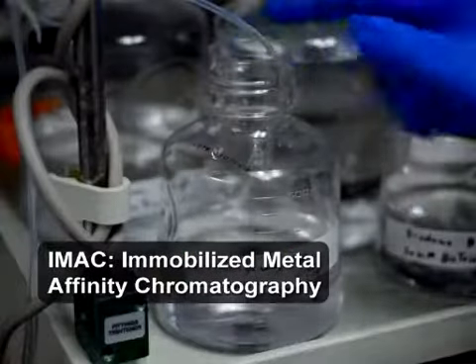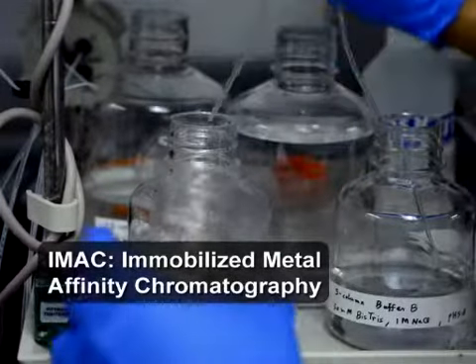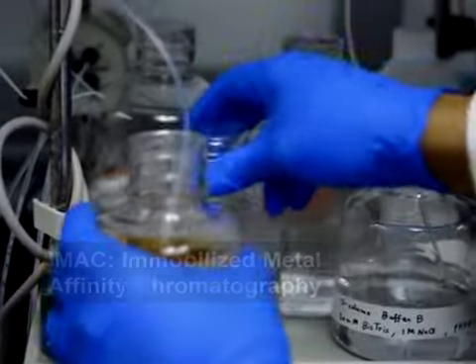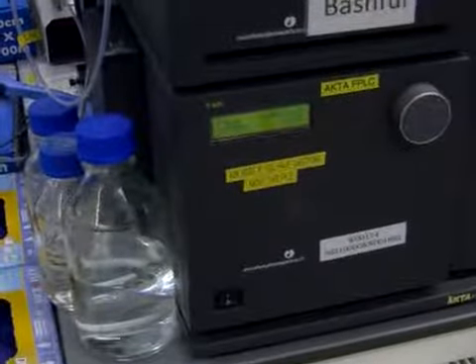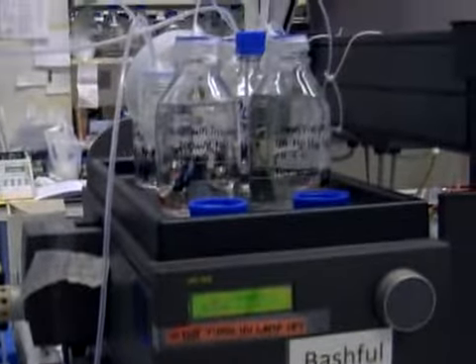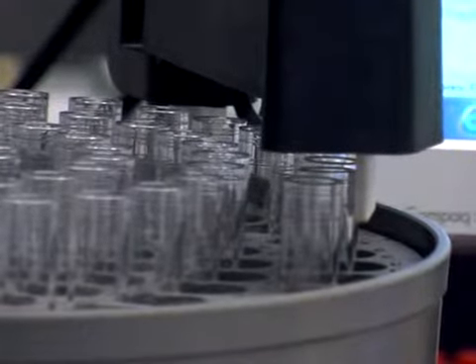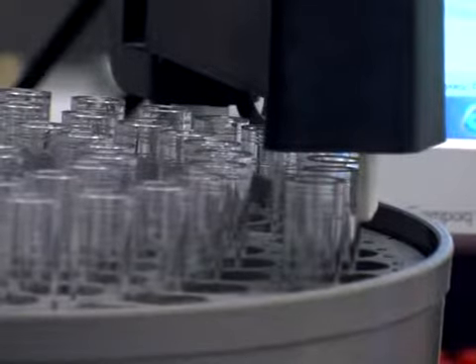Another form of column chromatography frequently used to separate proteins is immobilized metal affinity chromatography, or IMAC. In IMAC, the stationary phase possesses a ligand with a metal ion, which binds to a histidine tag on the protein of interest. All other components of the mixture exit the column. The protein is then eluted with a solution of imidazole, which has a similar structure to histidine and binds more strongly with the metal ion.